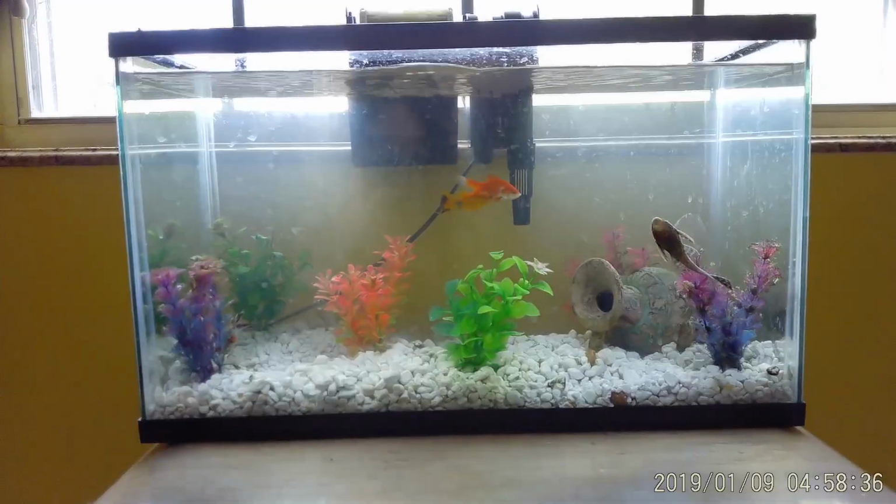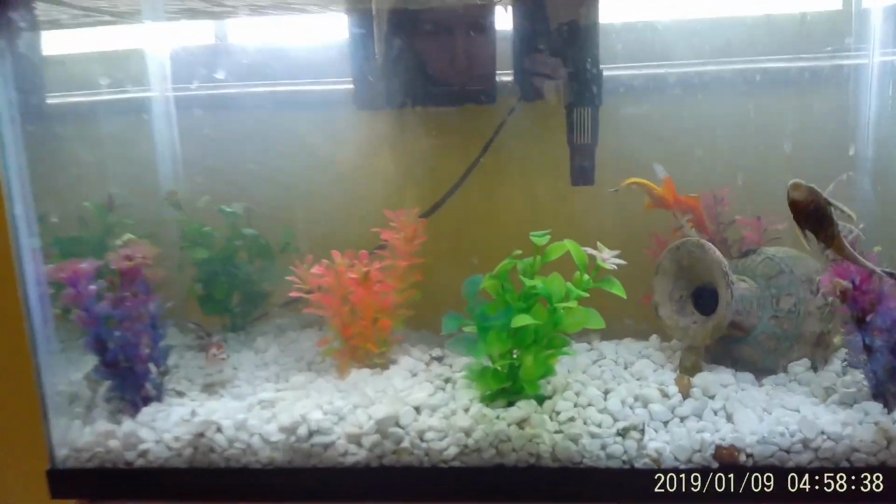You're about to see some really cool microorganisms. Enjoy!